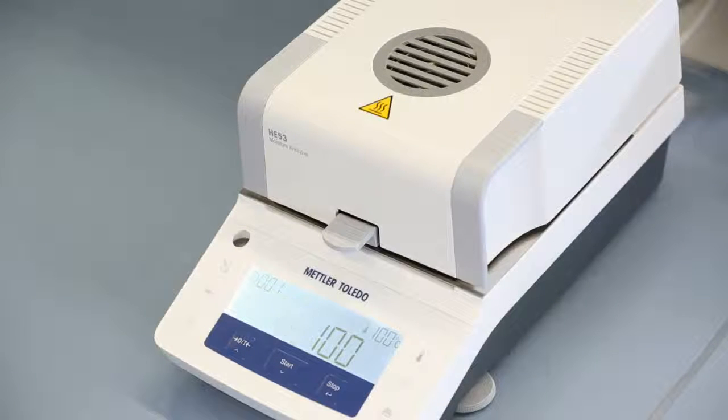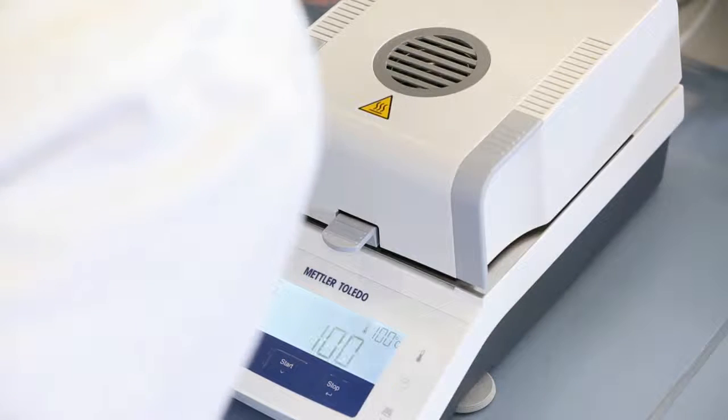After 15 minutes, read the thermometer and enter that temperature.